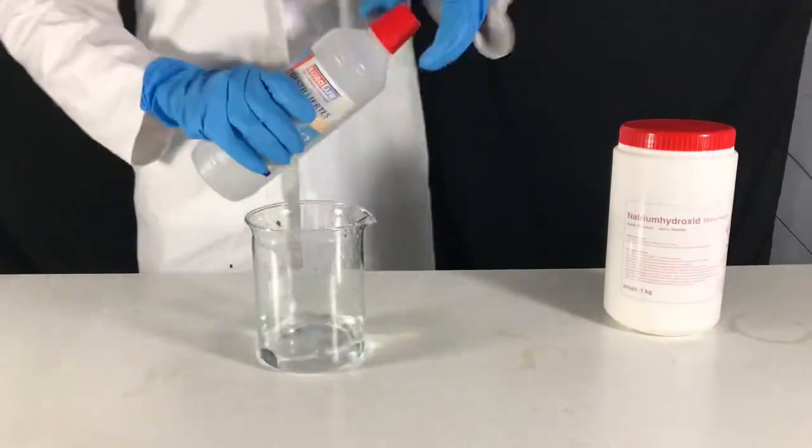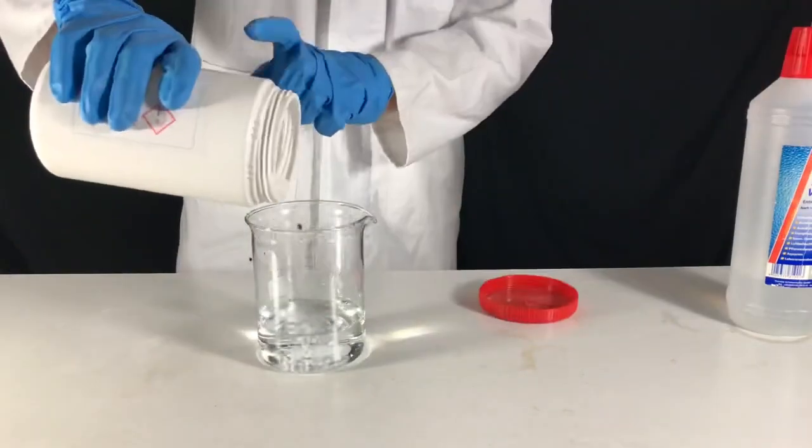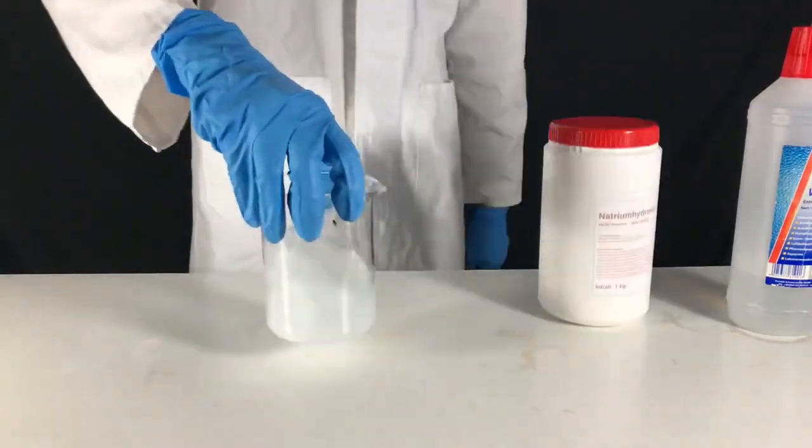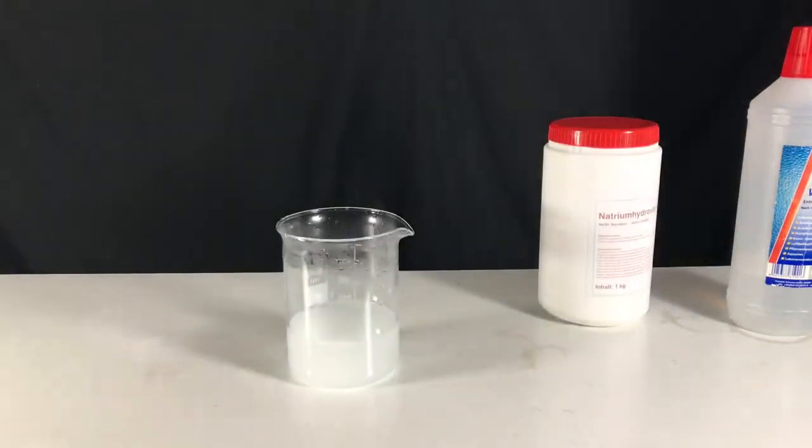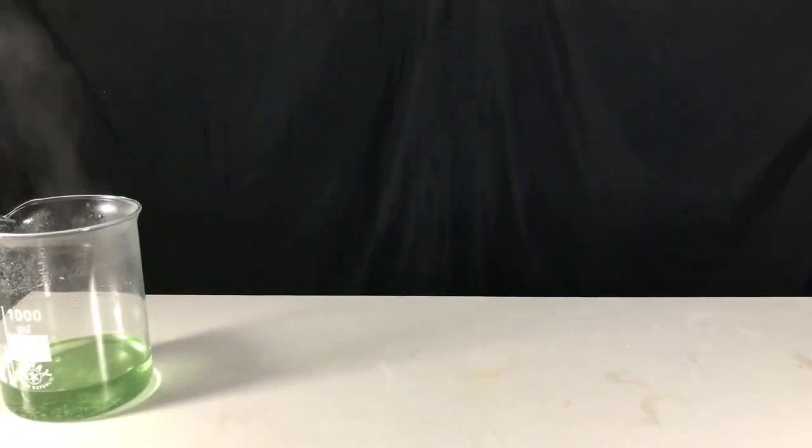We start off by dissolving some sodium hydroxide in distilled water. You have to be careful when dissolving sodium hydroxide because a lot of heat will be generated.